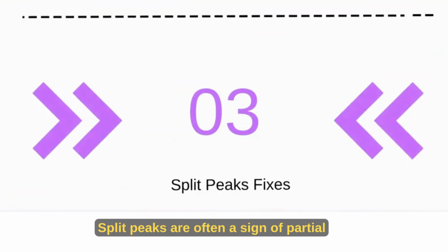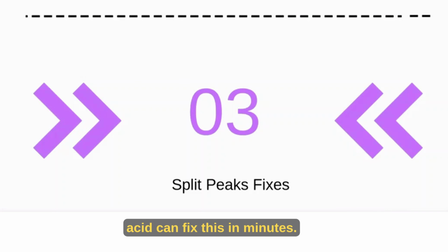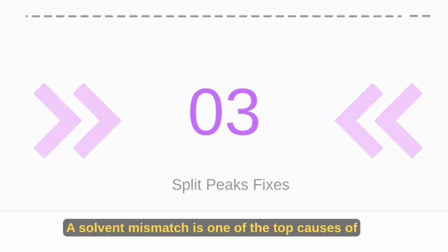Clear inlet blockage. Split peaks are often a sign of partial blockage. Cleaning or sonication of the frit in nitric acid can fix this in minutes. Once reinstalled, your single sharp peak should return.